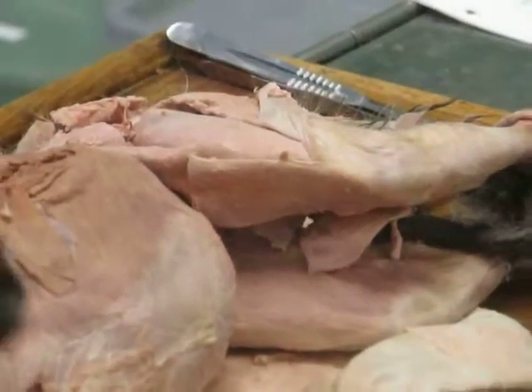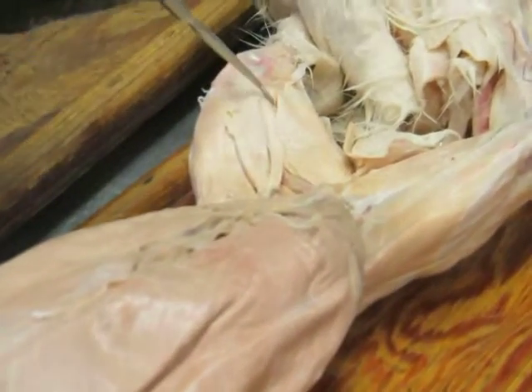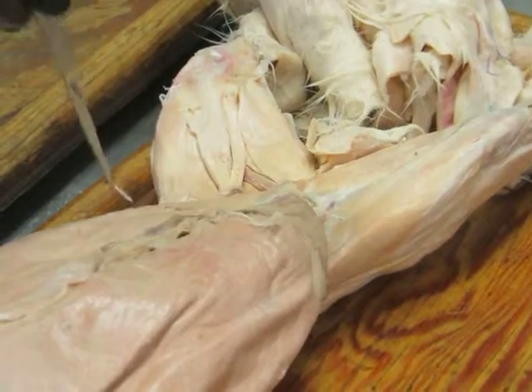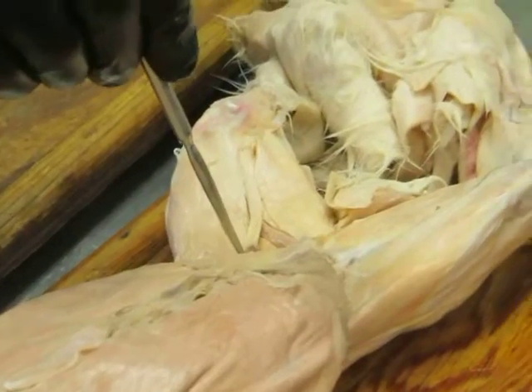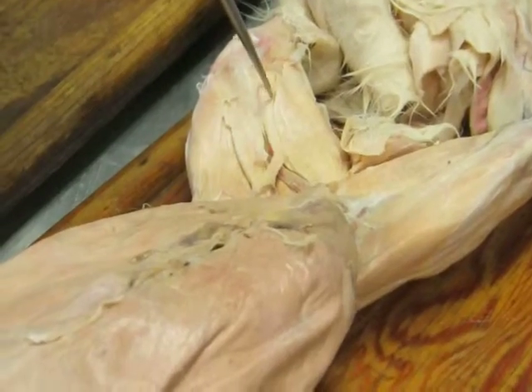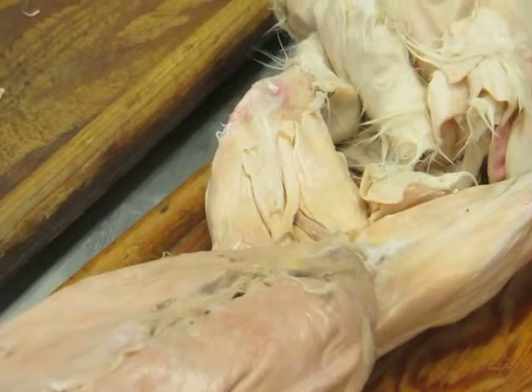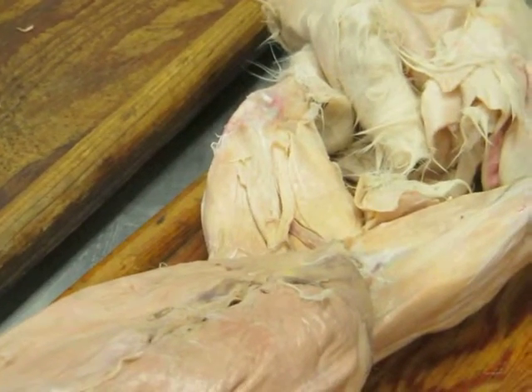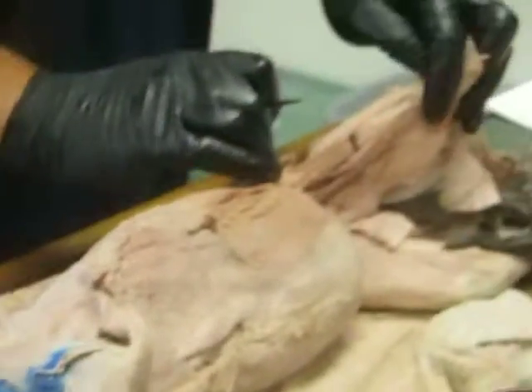Okay. I just want to point it out right away because it's very confusing, because in the rabbit, the sartorius looks extremely different. In the rabbit, the sartorius is a little strap muscle that comes, rather than coming all the way off from the crest of the ilium, comes way far back here by the pubic symphysis and runs just right along the inner side of the thigh, like that. And that's the sartorius in the rabbit. And that, by far, is the biggest difference between cats and rabbits in these pelvic muscles, is the sartorius. Okay. So there's sartorius, and I'm going to just flip it back.